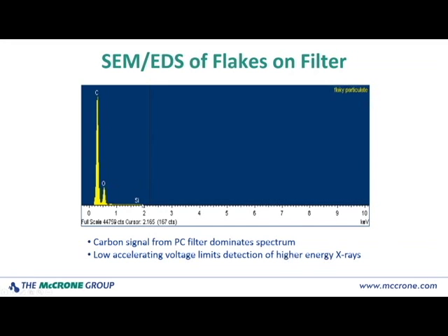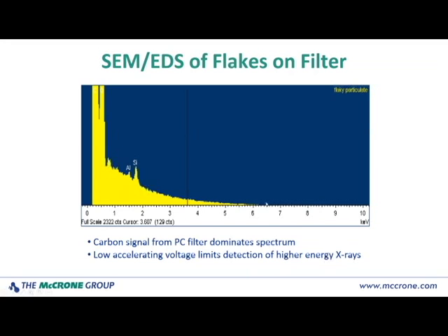If you had elements in the sample that were of interest but didn't generate X-rays except at higher energies, you wouldn't even be seeing those. Now if we blow up this spectrum, we expand the y-axis, now we can see that we've got a minor to trace silicon peak here at best, and we've got an extremely small aluminum peak.